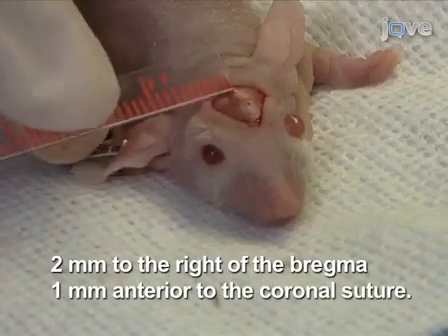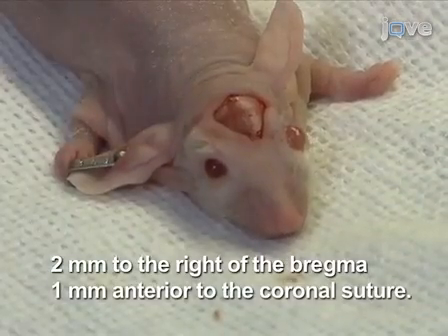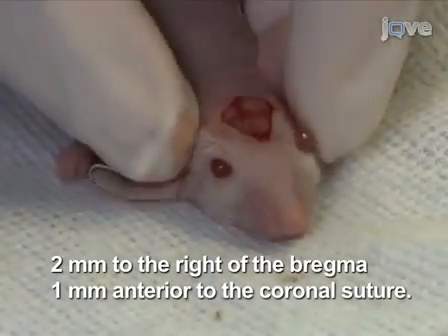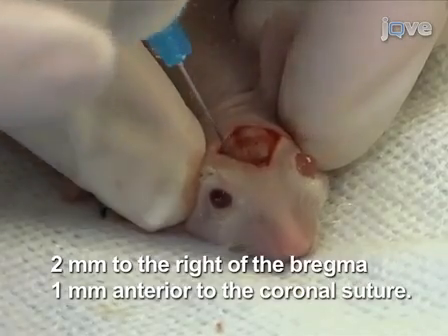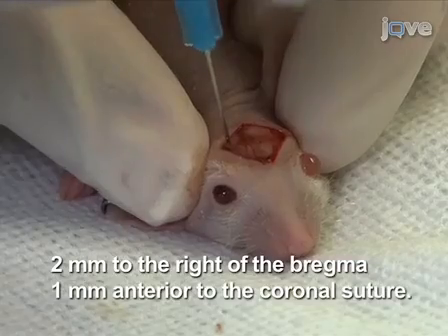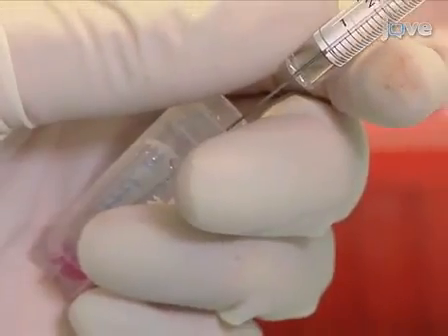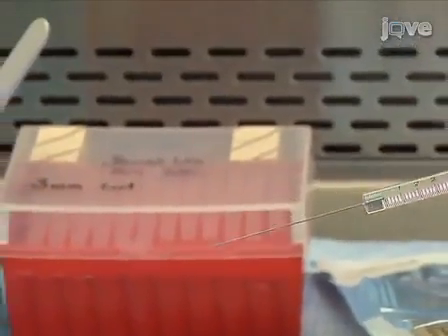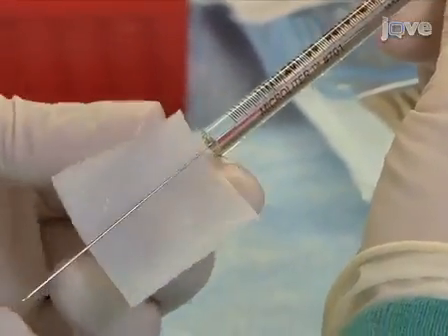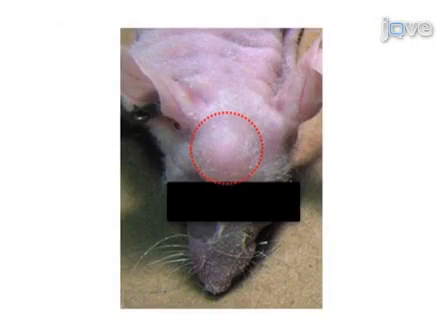To create an opening for the injection of tumor cells, use a sterile 25 gauge sharp needle to puncture the skull 2 mm to the right of bregma and 1 mm anterior to the coronal suture. Mix the contents of the cell suspension by tapping. Load the syringe with the desired amount of cell suspension. Avoid creating air bubbles. Clean the outside of the syringe with an alcohol swab to remove any adherent cells. This will help prevent extracranial tumor establishment and growth, as shown here.